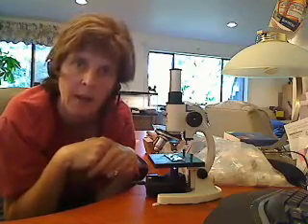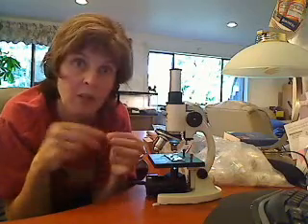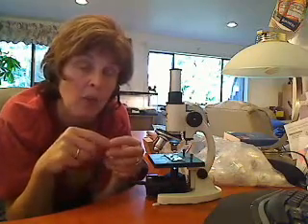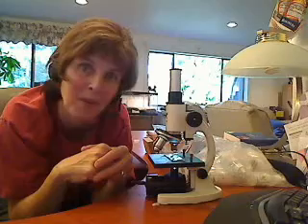I highly recommend you play with your microscope. Go out and find grass. Write a small letter — because microscopes reverse letters, so it's kind of fun to see what they do. Find some little piece of lettuce and peel a thin layer to see some cells. Play with your stains — I think you have a couple in your kit — to see if you can see cell features. With the onion cell, you should be able to see the nucleus, so look for it. You should also be able to see the cell wall, a very common feature in plant cells. Have a great day and enjoy playing with your microscope.